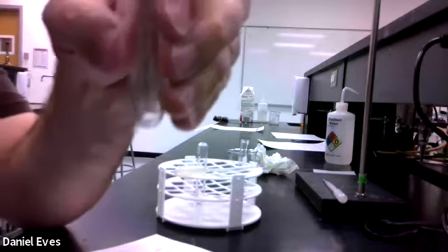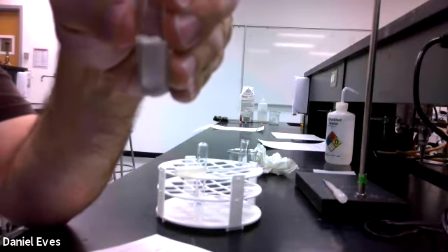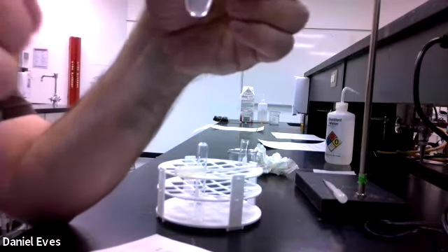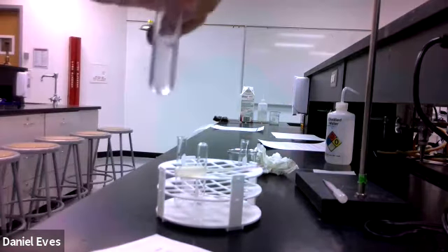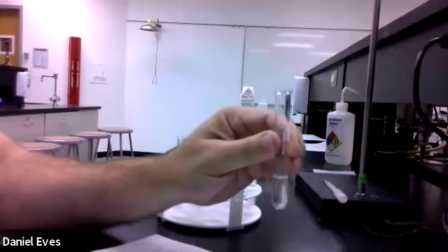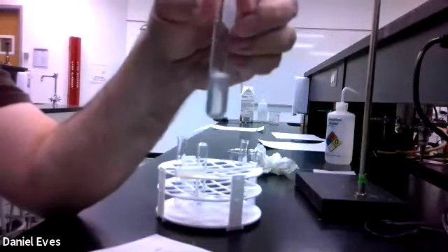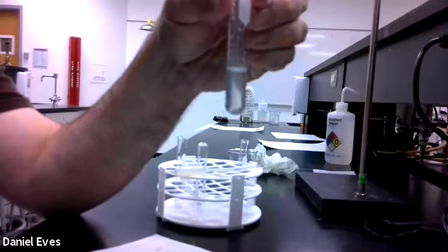So the supernatant is the liquid above the solid, and so we're gonna go ahead and pour all of that into here so that we have just a liquid. Okay, and so we have the liquid there, and then we're going to add some hydrochloric acid to it and see if we can make it shift back. So we're going to go ahead, 1, 2, 3, 4, 5, 6, 7.